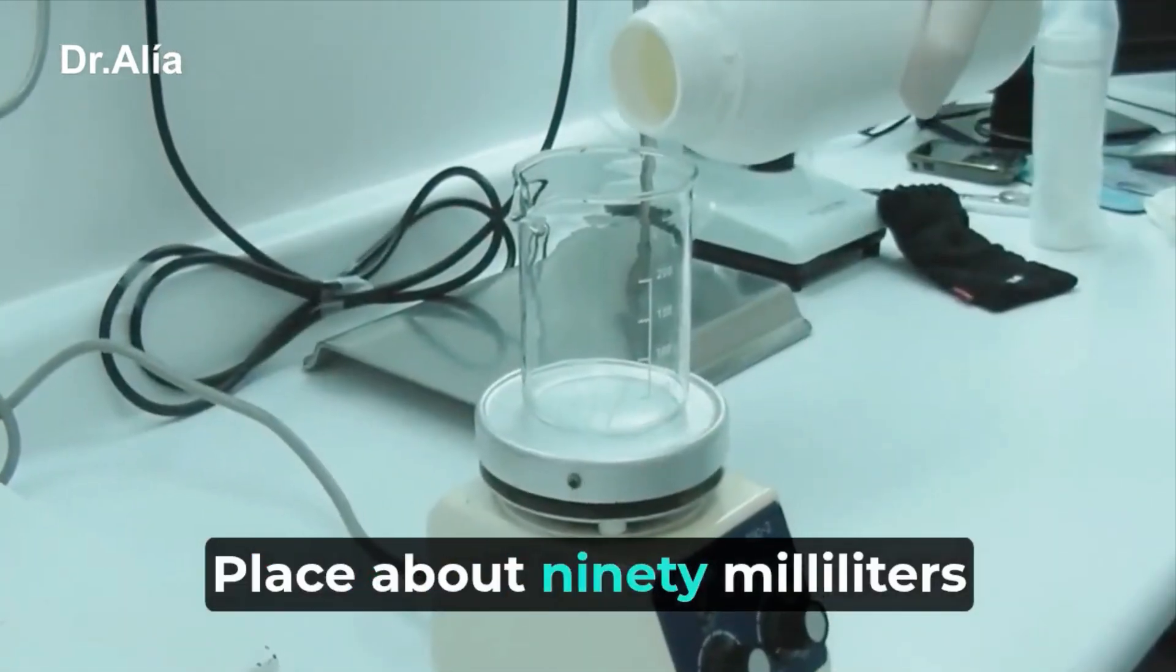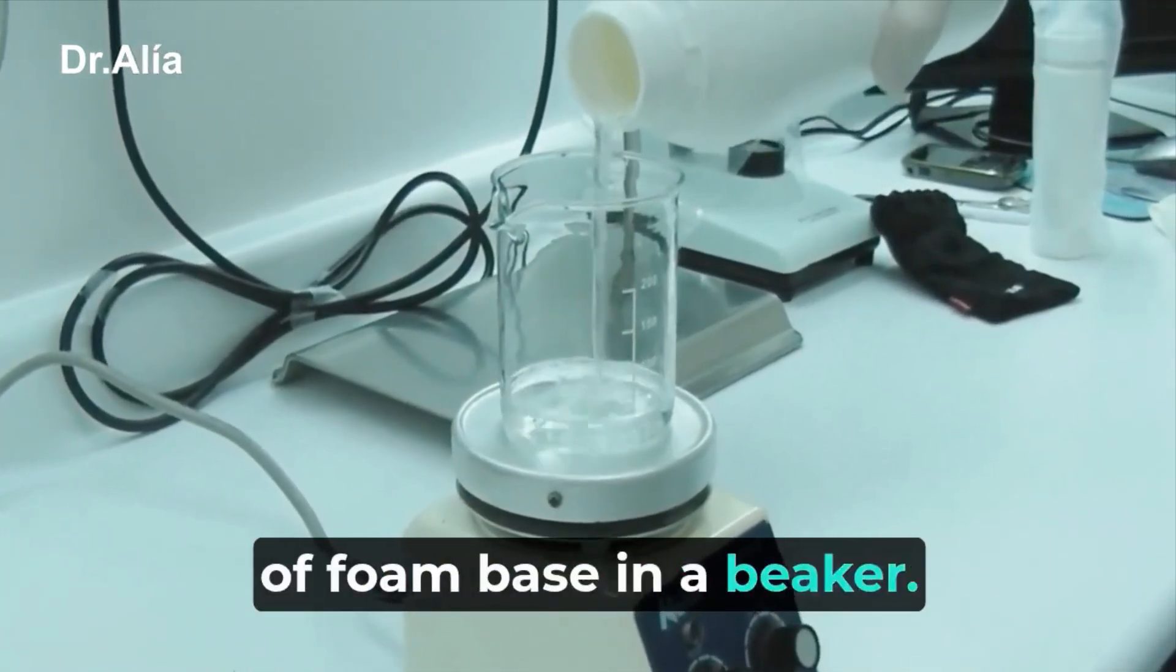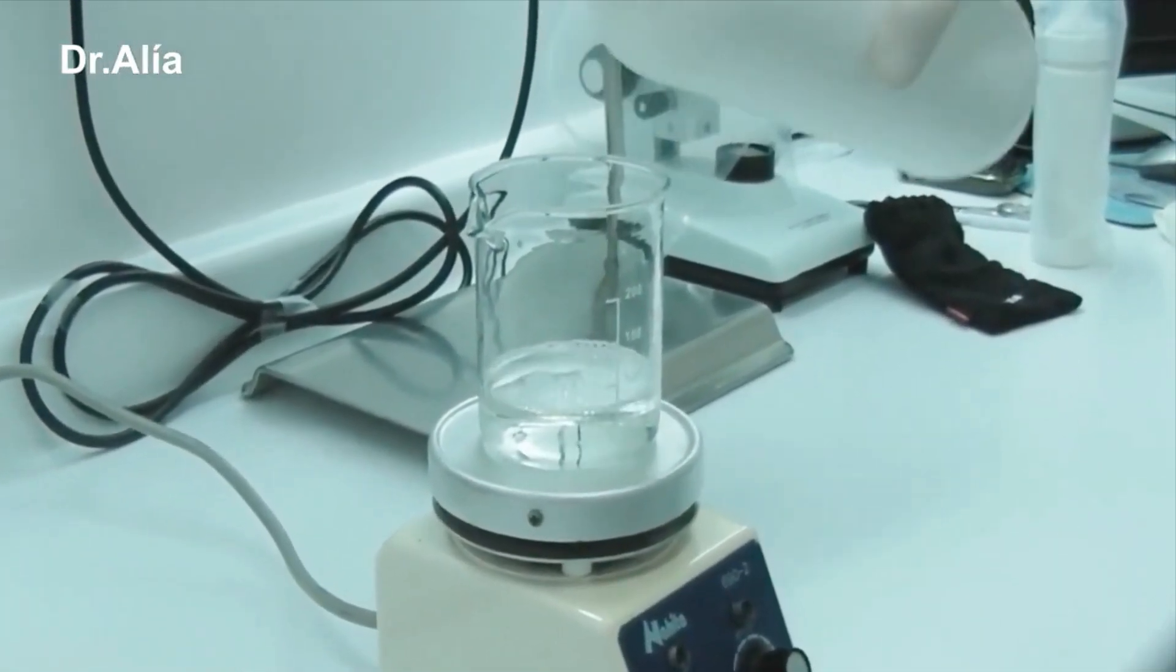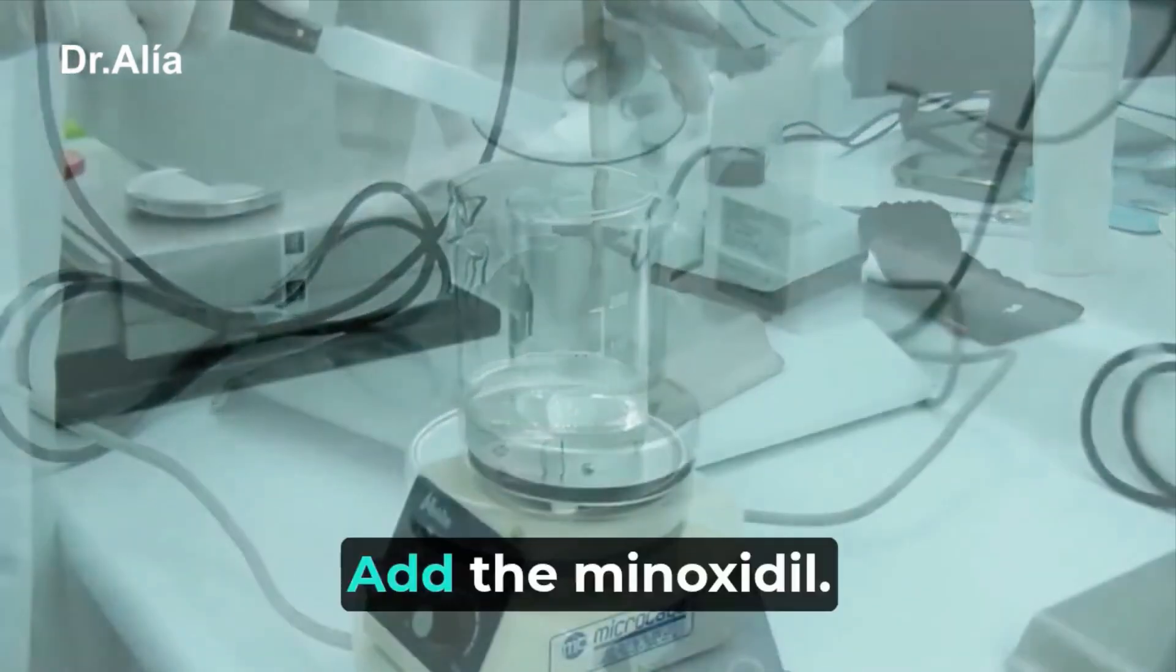Place about 90 milliliters of foam base in a beaker. Add the minoxidil.